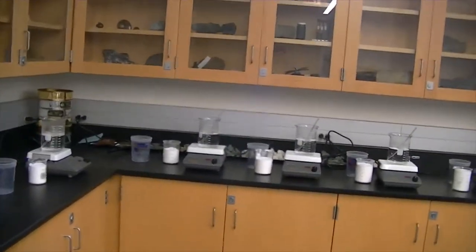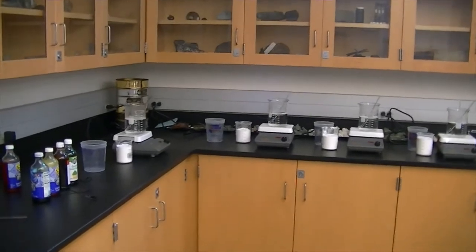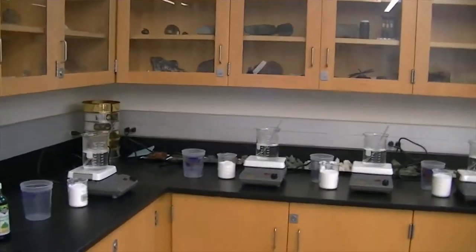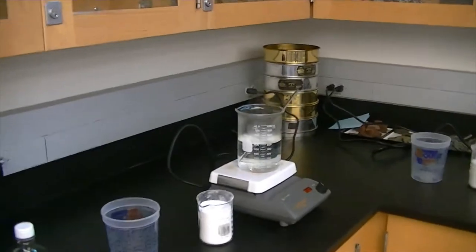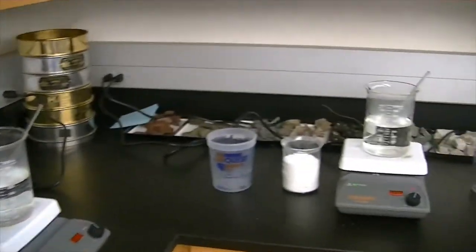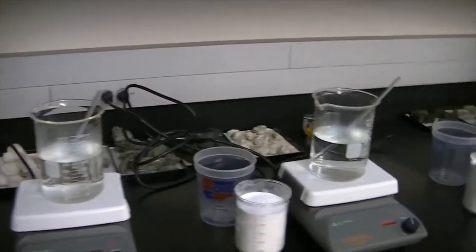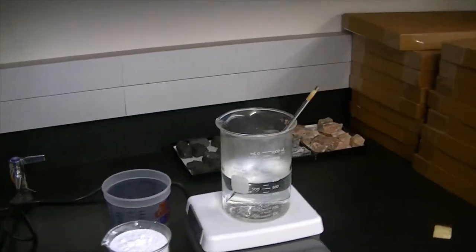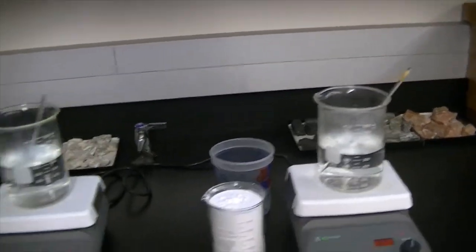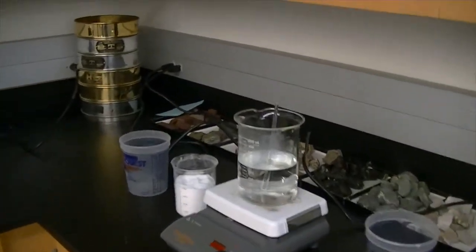For the first lab in our geology class, Geology 110, we're going to do an experiment. The end result of this experiment, which we will not find out until the very end of the semester — the second week of December — we're going to see how our crystals turn out. What we're going to do is grow crystals.